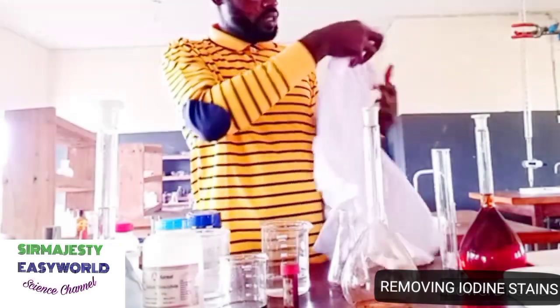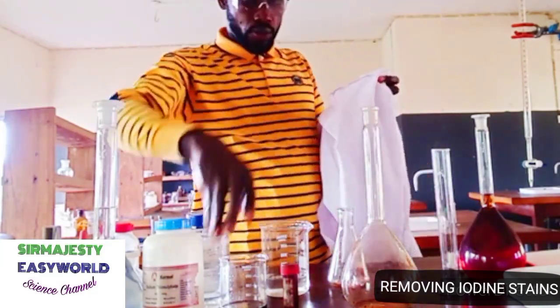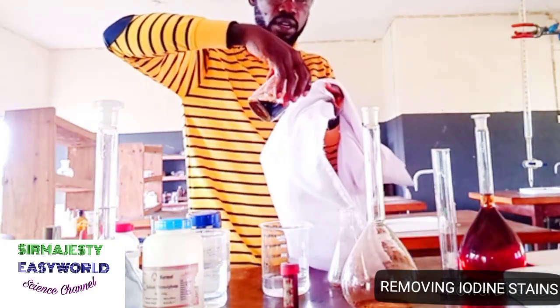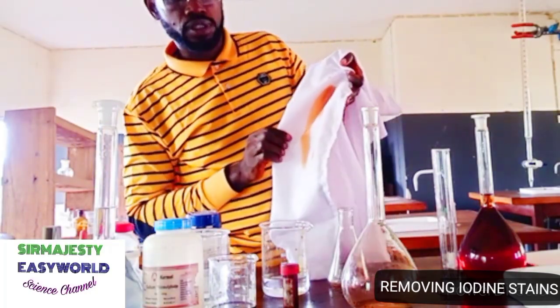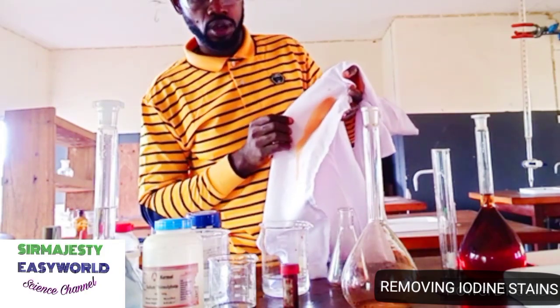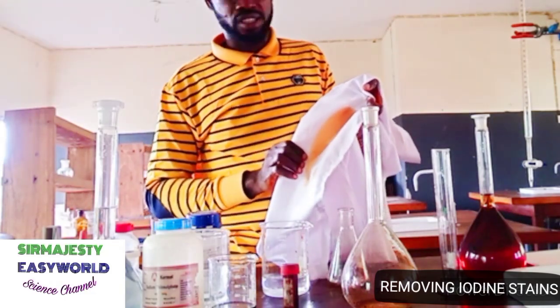Let's say I mistakenly mess around now. All of this, you see? Oh my God, you see? Washing will not remove it. So you can be patient for it to sublime, but this will take about a week, or let's say 4 days. It will sublime and go this way. But removing this by washing in any liquid is not going to be easy.